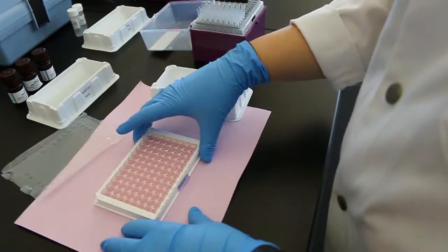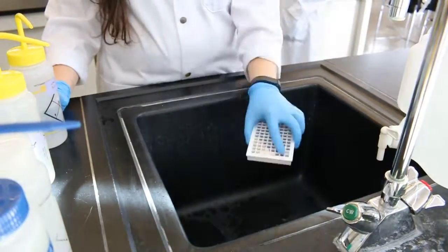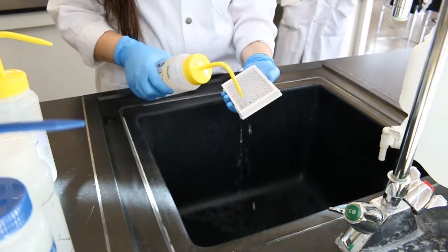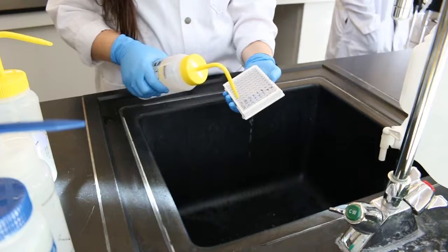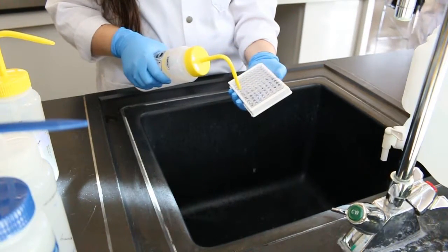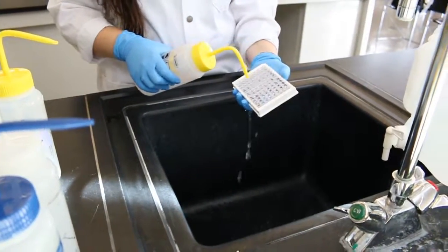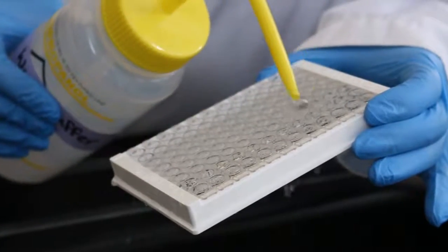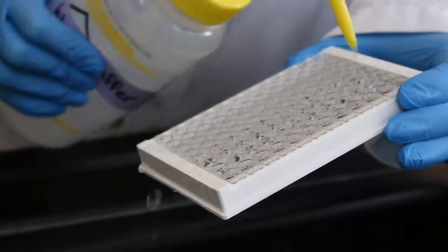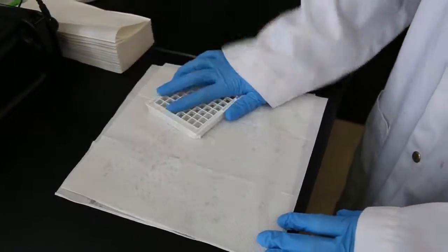After the incubation period, the covering is again removed and contents are vigorously shaken from the wells into a sink. The wells are washed three times using a multi-channel pipette or wash bottle using the wash buffer solution provided. Contents of the wells are dumped into a sink between each wash. Following the wash, the plate is pat dry on an absorbent surface.